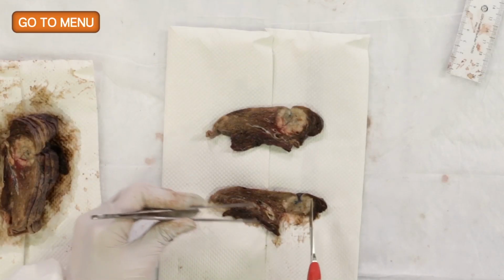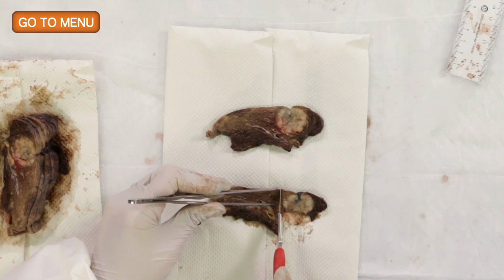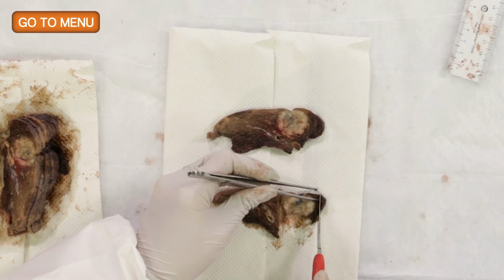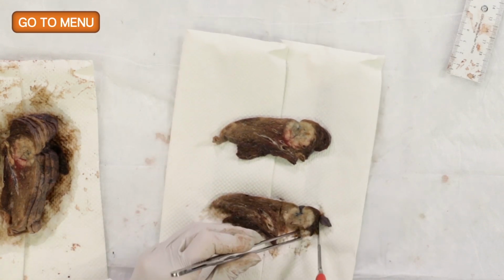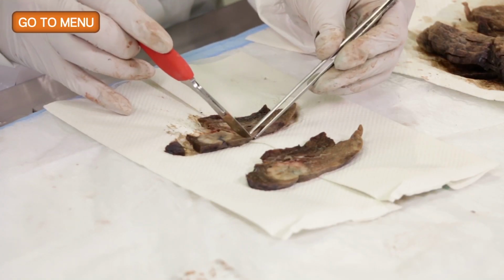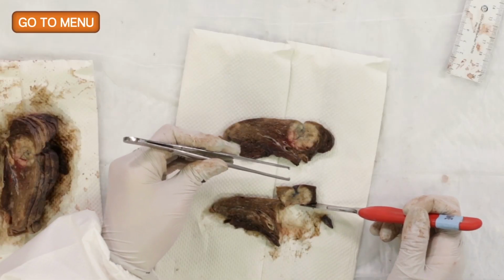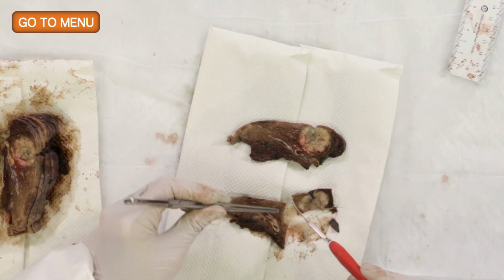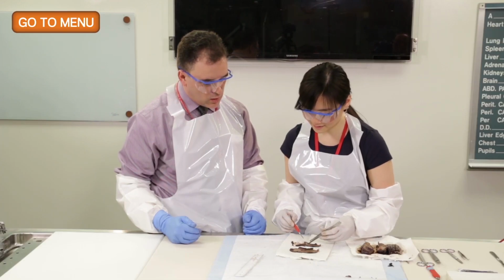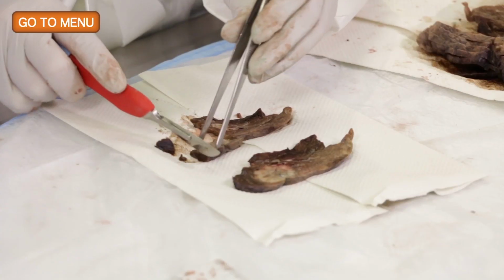Sounds good. So I just removed the tumor to the bronchovascular margin. I believe this section can go in its entirety. So it would also include the pleura, and it's practically a full face of the tumor, and it goes from the tumor to normal as well. Okay, so that is a slightly big section. It is. We might need to trim that down a little bit on the sides, so we won't get the tumor to lung parenchyma from this section. Okay. But again, we want to keep our histology technicians happy and able to do their job.